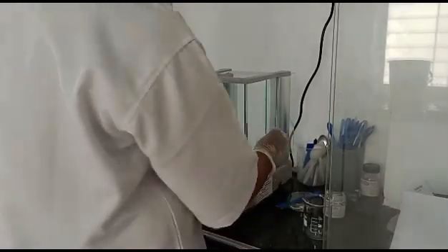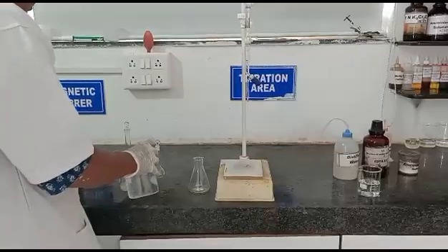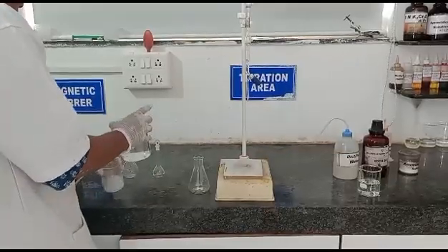Now we have weighed calcium carbonate and we will transfer it in a beaker. Now let's dissolve this calcium carbonate in distilled water.